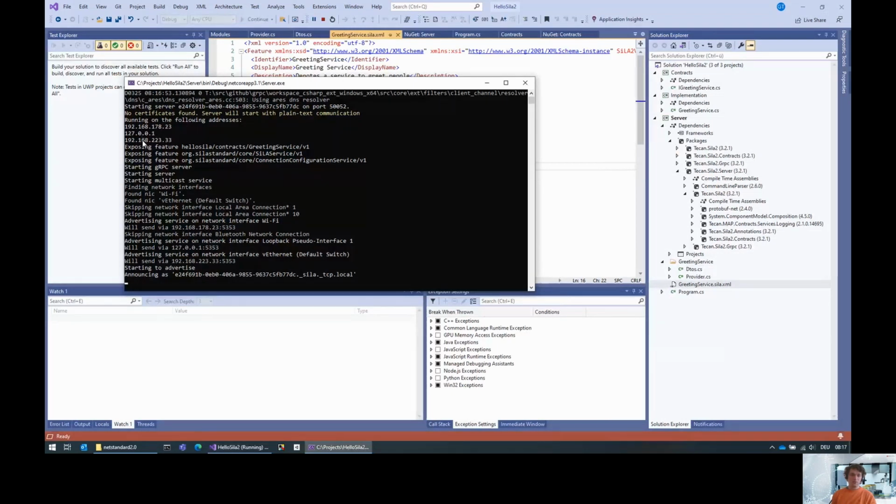Then it shows you the addresses on which the server is accepting incoming requests. And then it says we have three features here. One is the greeting service that we generated. One is the SiLA service, so the discovery service. This feature is actually mandatory. And because we're using the SDK 3.2, this SDK comes with server-initiated connections by default. So our server does implement server-initiated connections as well. I'm going into details for that in a separate video. But this is basically the fact that this is a SiLA 2.1 server.